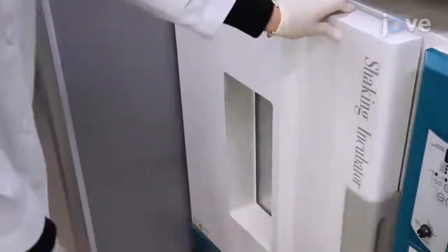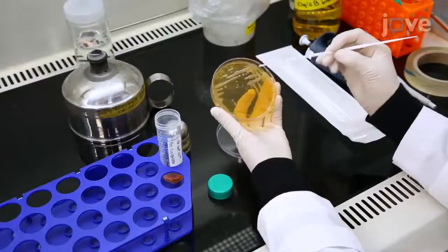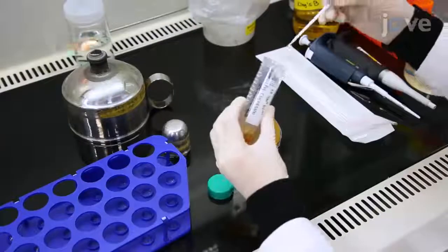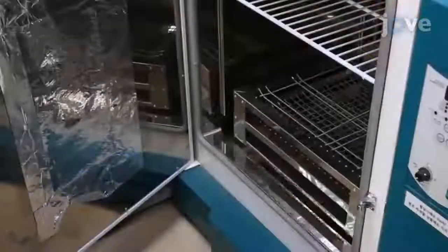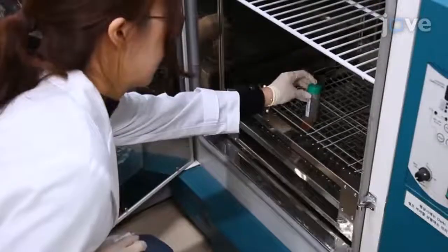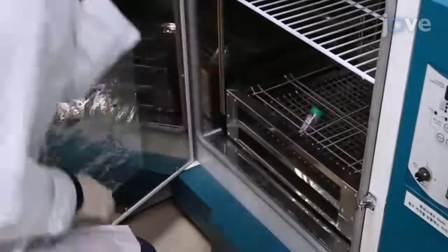After this, inoculate one bacterial colony into King's B liquid medium with an antibiotic appropriate for the vector. Incubate overnight at 28 degrees Celsius with shaking at 200 RPM.